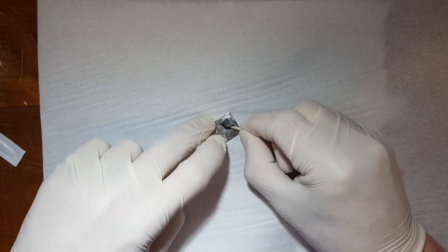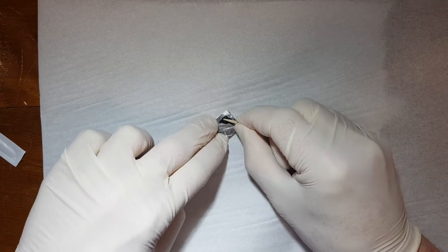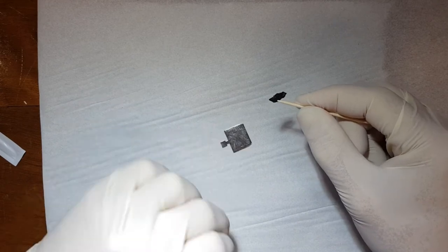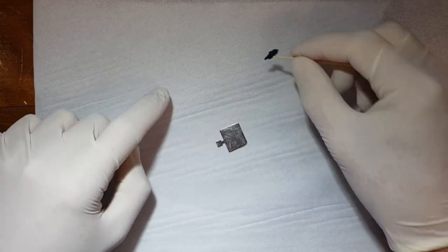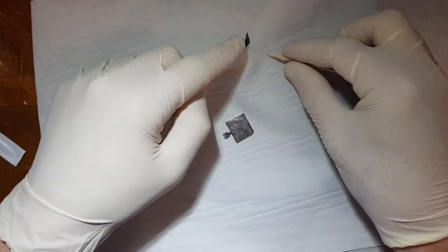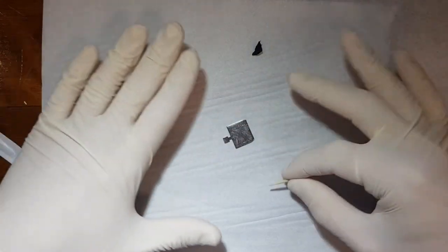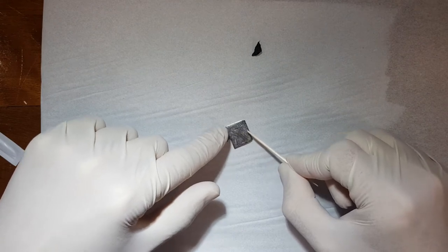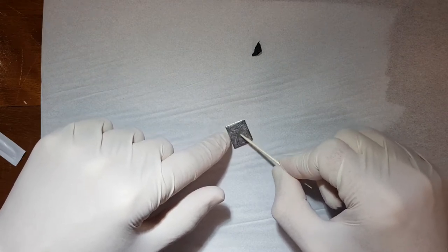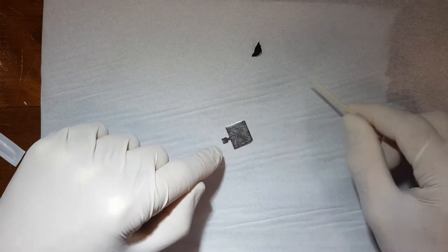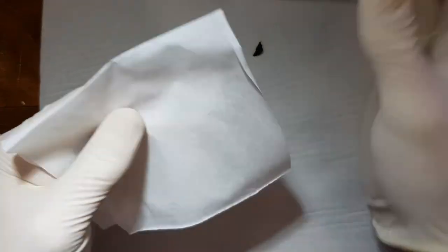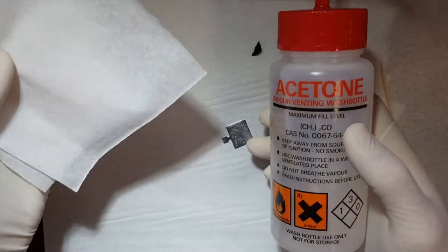I gently work my way like that, and I'm doing it slowly to show but obviously you can really go for it. And there we go, now that's removed. I just put it on the side like that because I'll be throwing it away along with the paper towel. But I'm not sure if the camera can see it, but there's obviously now still a couple of spots of dirt on this sample holder. So I use a kim wipe and I apply some acetone.